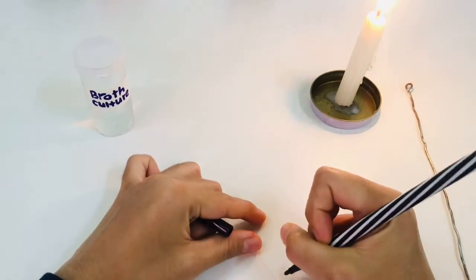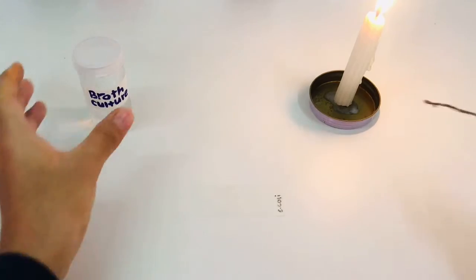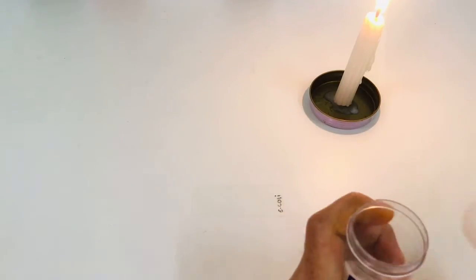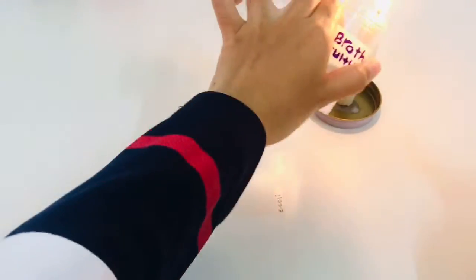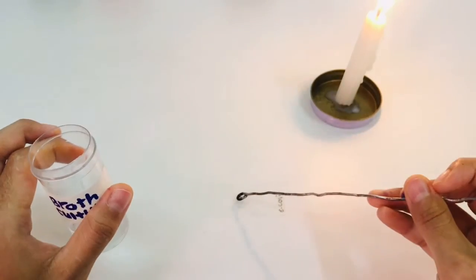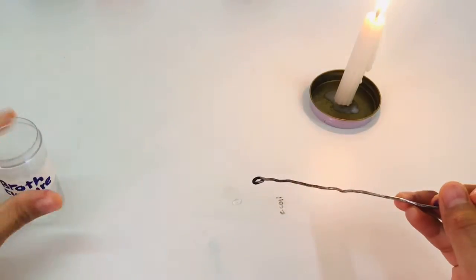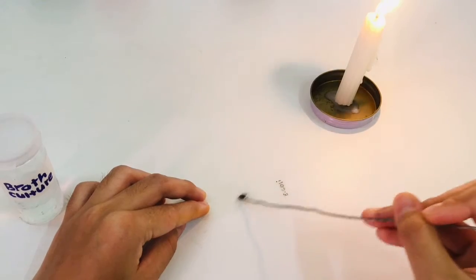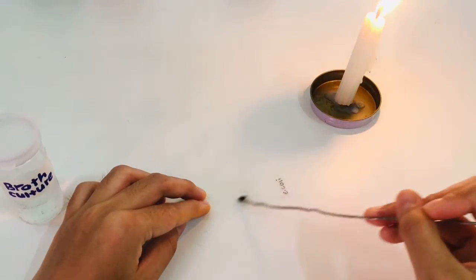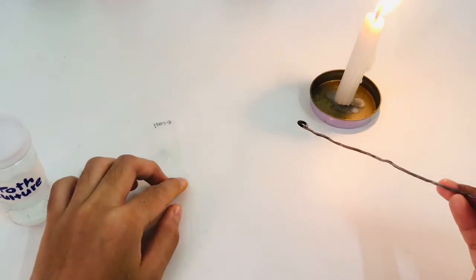First and foremost, we need to prepare a bacterial smear. Label one clean glass slide with the name of the organism. Then, with a sterile loop, place 1 to 2 loopfuls of culture onto the glass slide. With a circular movement of the loop, spread the cell suspension into an area approximately the size of a dime. Allow the slide to air dry completely.